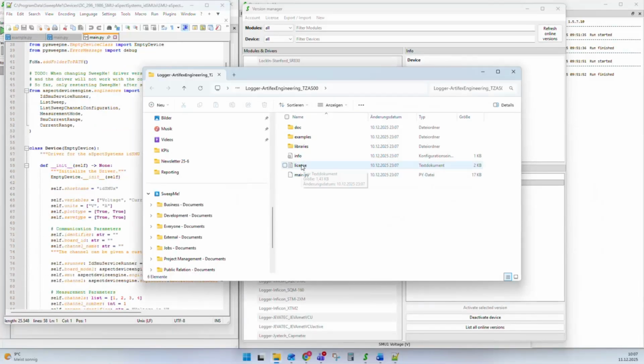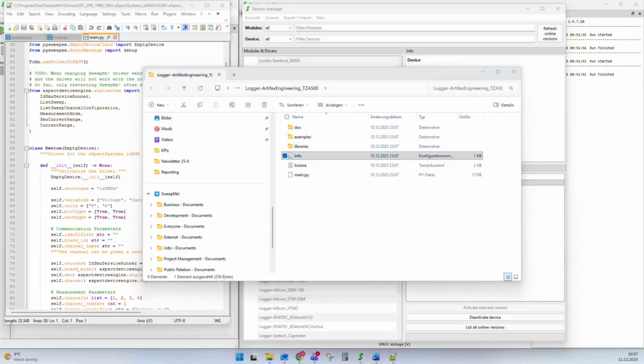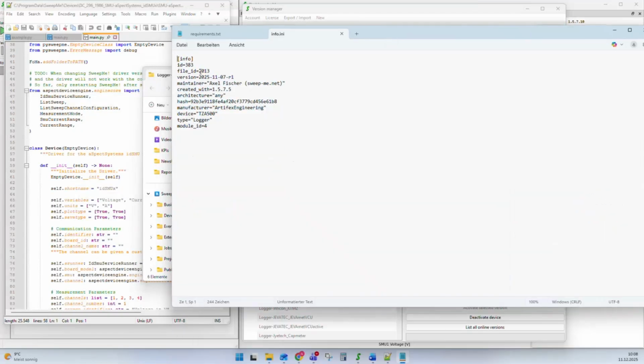Additionally, there is typically a license file in there. We try to use the MIT license because this is a very free license that gives all users a lot of freedom to do many things with it, also to use it commercially and so on. In the driver folder, you also find an info file. Let's have a look into it. There is just a summary of different properties and also a hash that makes sure that we know the driver was not changed if it was downloaded from the server, and different other IDs to make sure we can identify the driver in our software.